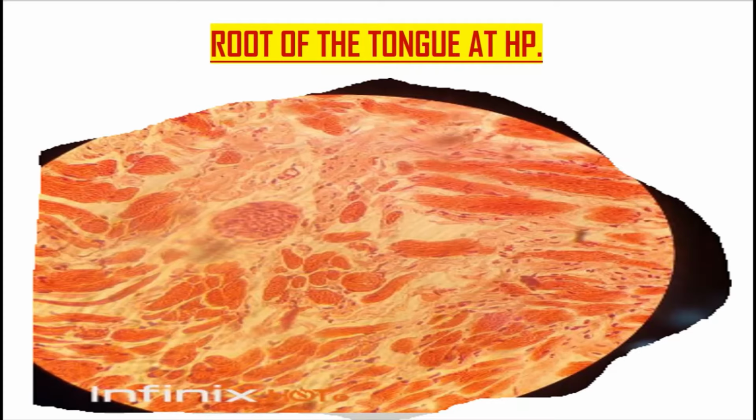At high power, they appear like this. These are the muscle fibers. This here is a muscle fascicle in longitudinal section, and even this one here is in longitudinal section. So draw these in longitudinal section. What you notice in these muscles is that they have a lot of nuclei.